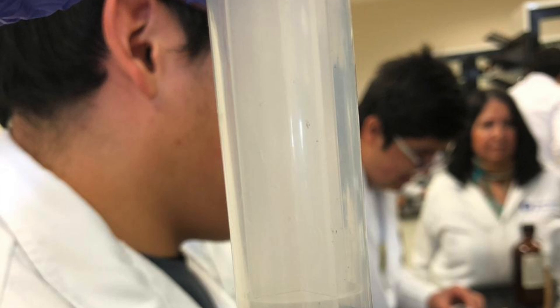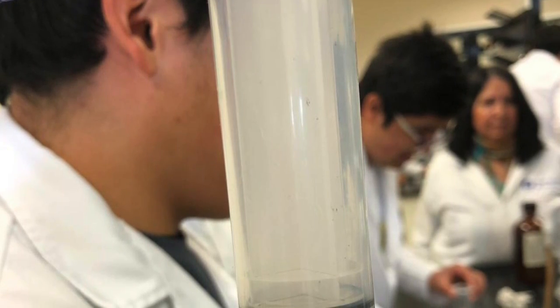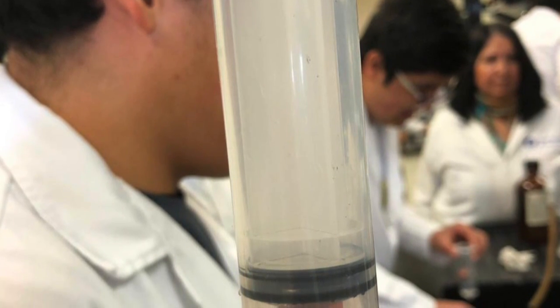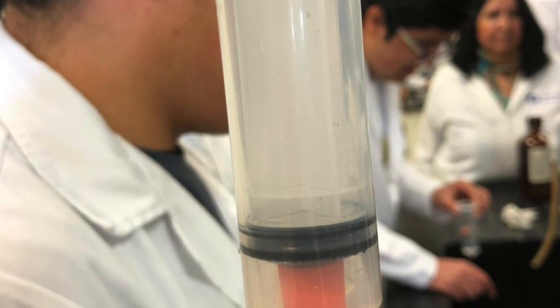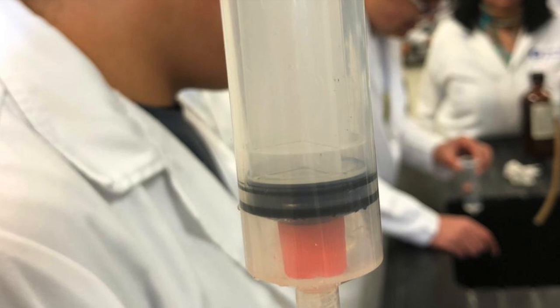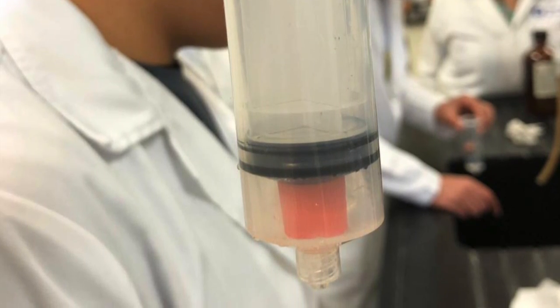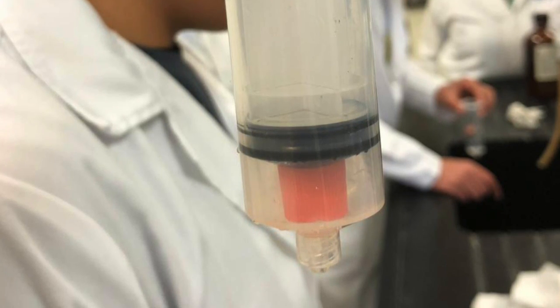To prepare 50 milliliters of carbon dioxide, we needed 0.22 grams of sodium bicarbonate and 5 milliliters of acetic acid. When creating CO2, we obtained a foam like toothpaste. Its color was between white and transparent. The experiment we did with the CO2 was to put the fire near the tube, and it made an explosion very similar to when a balloon full of air thunders.